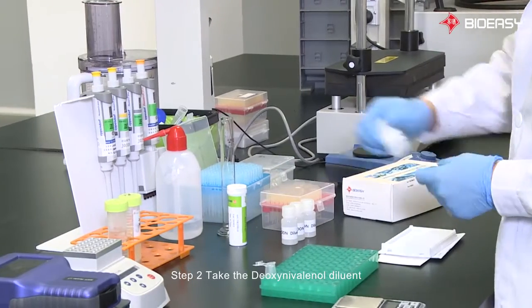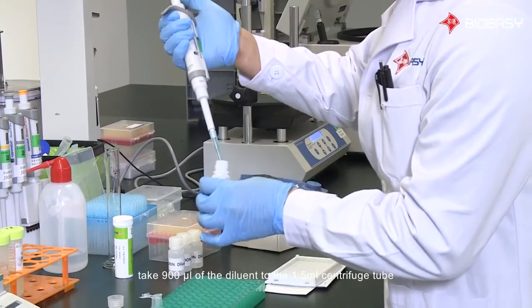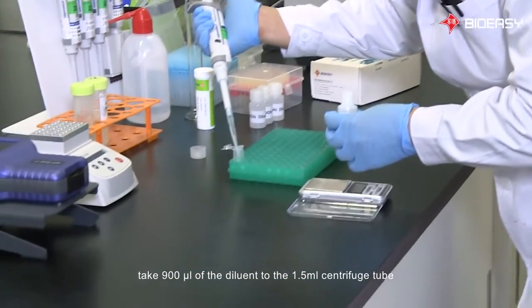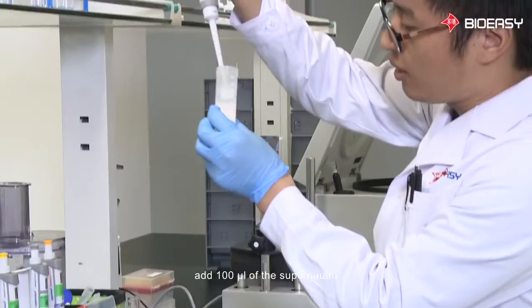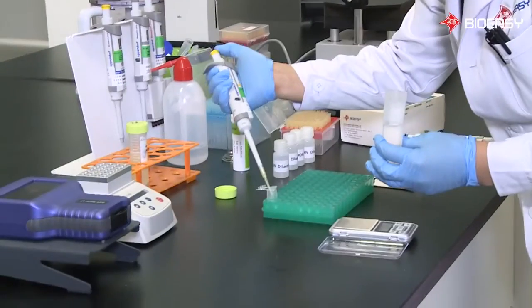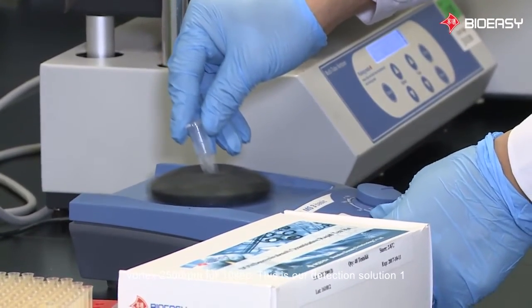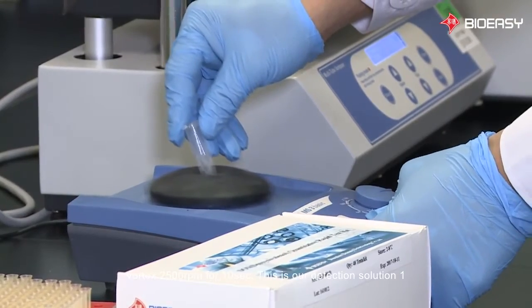Step 2. Take the deoxynivalenol diluent. Take 900 microliters of the diluent to the 1.5 milliliter centrifuge tube. Add 100 microliters of the supernatant. Vortex 2500 RPM for 10 seconds. This is our detection solution 1.